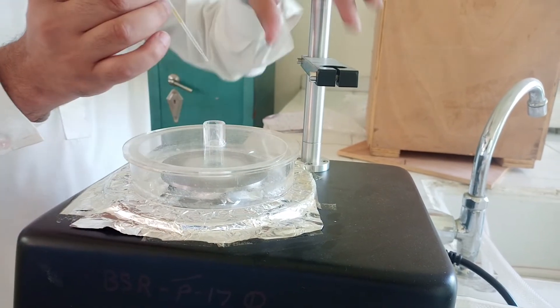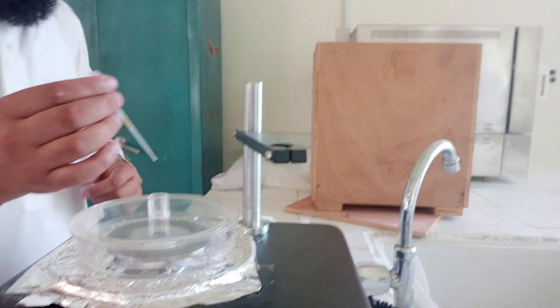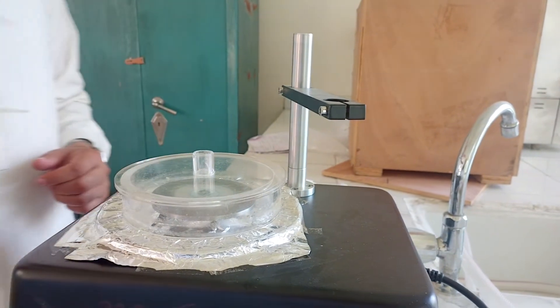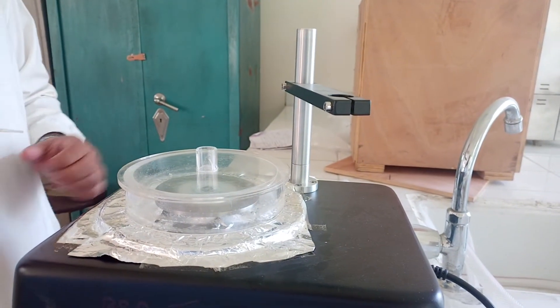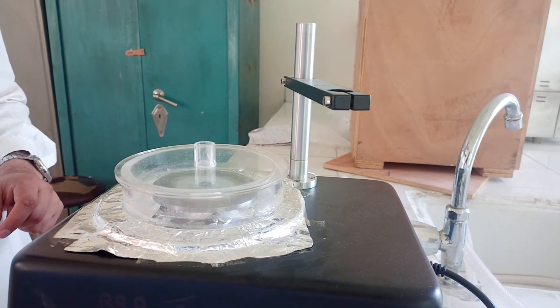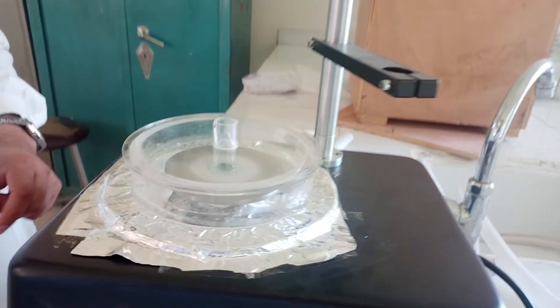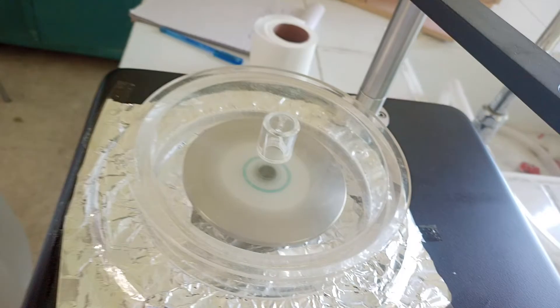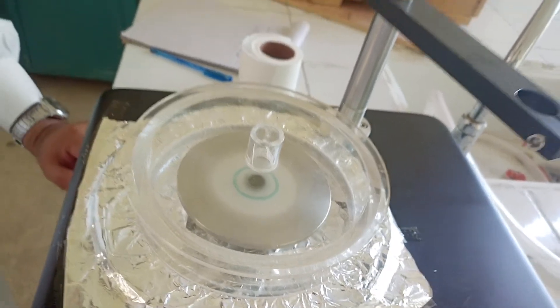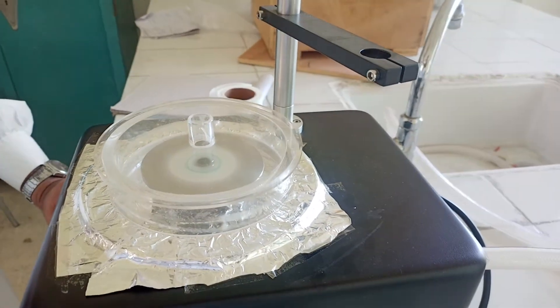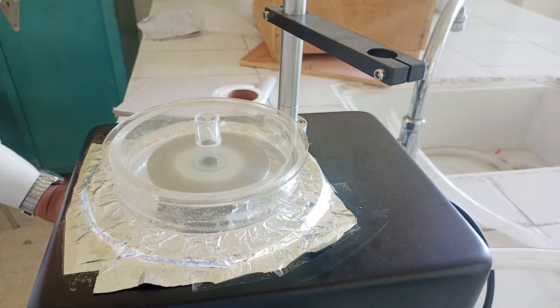We can also use a syringe as a dropper. We will take two cycles, therefore we have added three drops. And then again we will use second time. So now it is revolving at 5000 RPM for one minute.